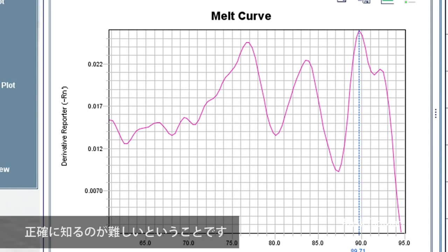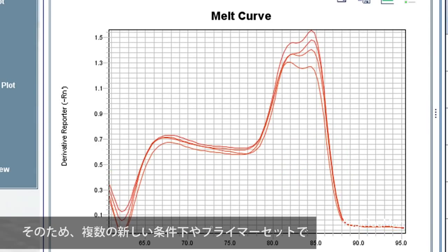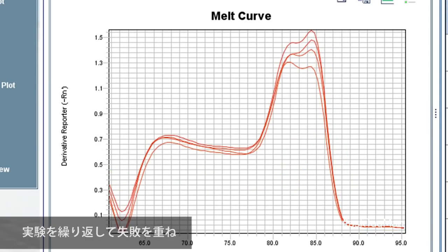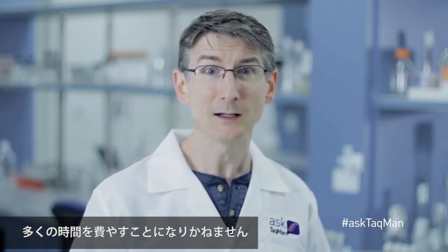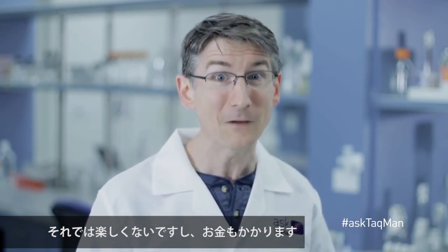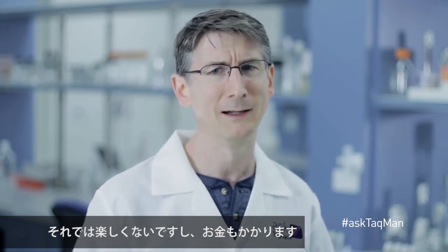But multiple discrete peaks are not the only thing that should concern you. Other anomalies such as asymmetrical peaks, shoulders, and unusually chunky peaks should make the user question the validity of their data. The problem is it's difficult to know exactly what's causing certain anomalies, so some users end up spending a lot of time repeating failed experiments under multiple new conditions or with multiple new primer sets.